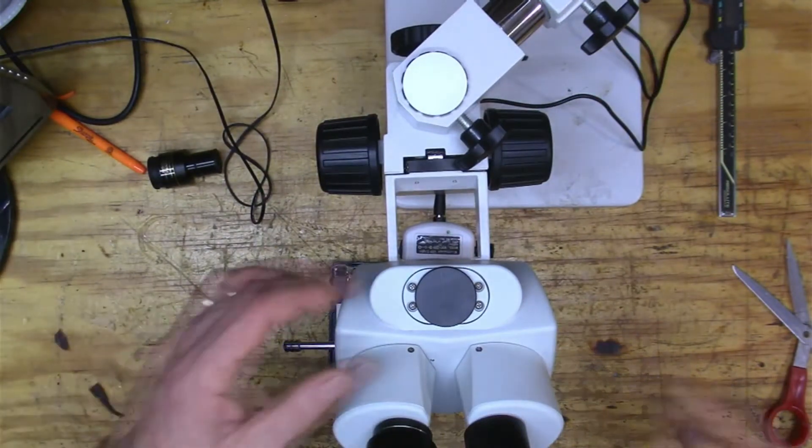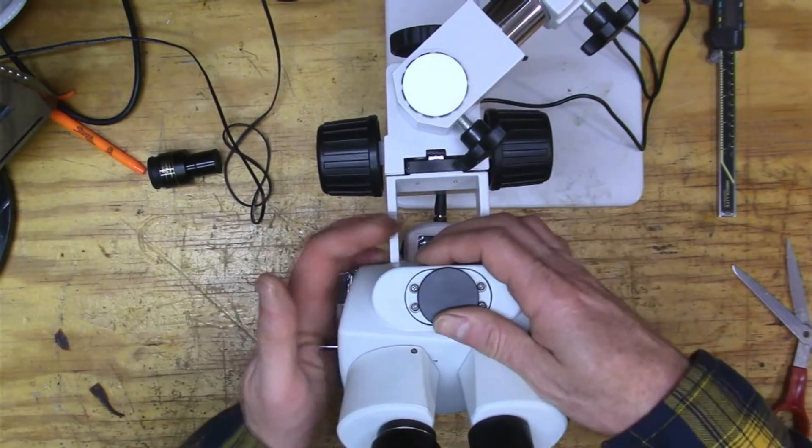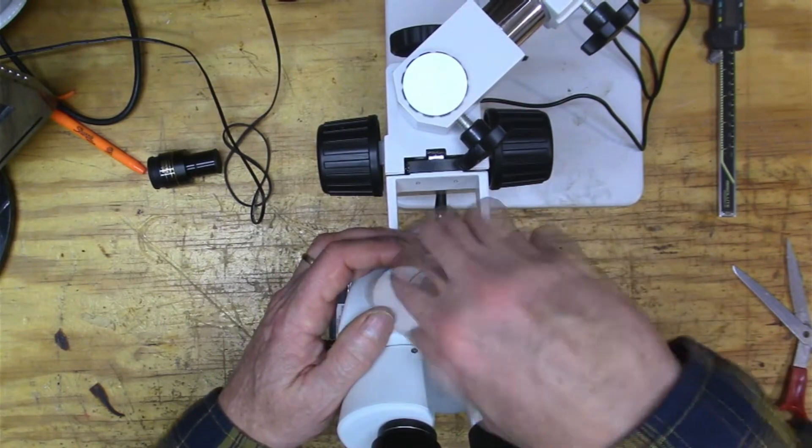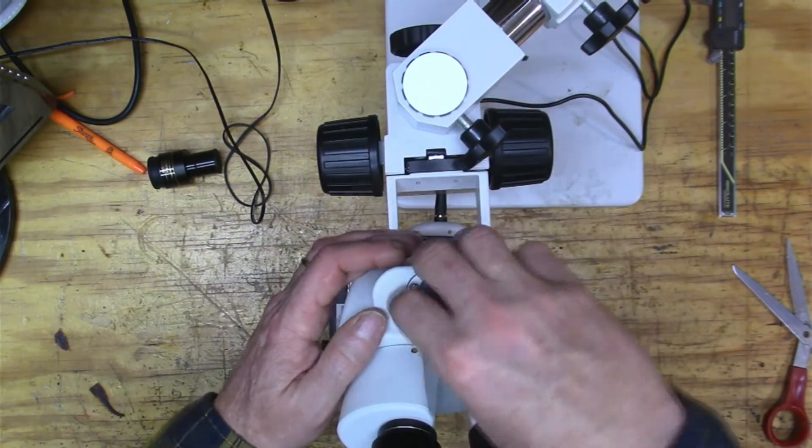And it took me a little bit to figure out, so I thought I'd just make a video of it if anybody else is interested in it, of what I came up with. So here's a microscope from the top.